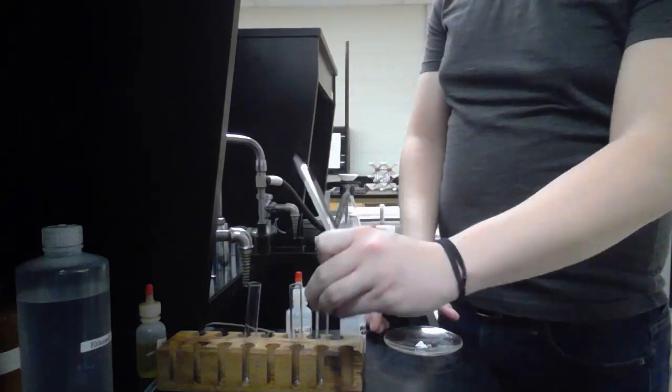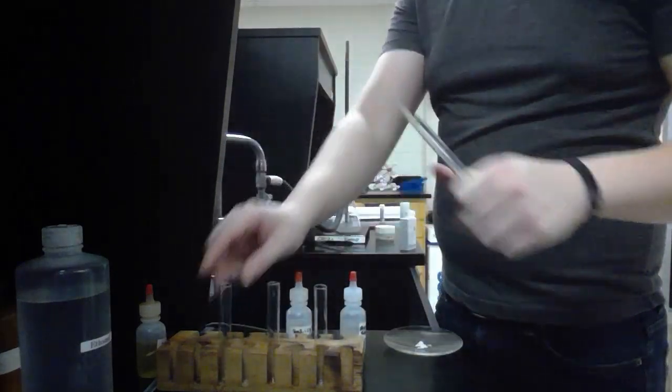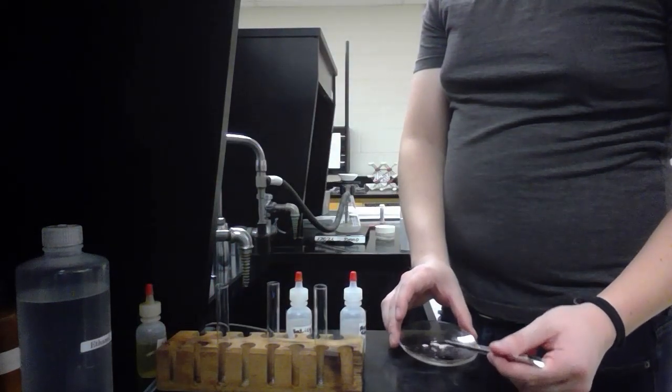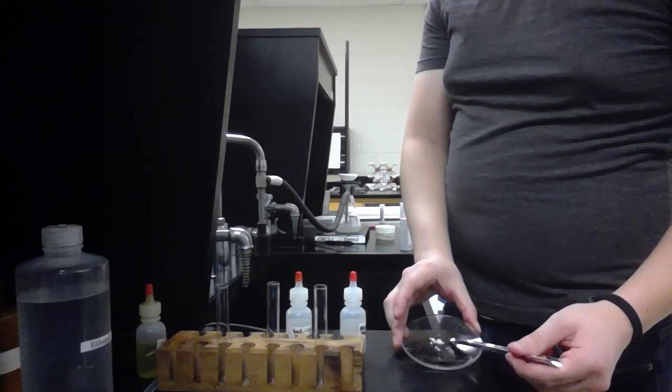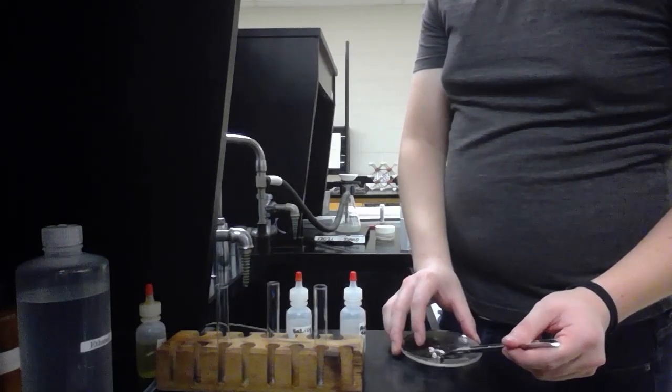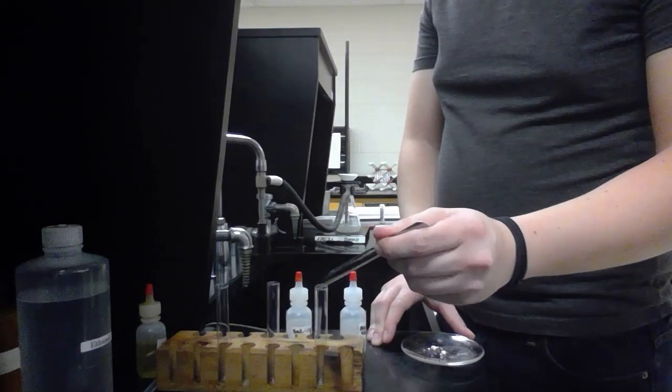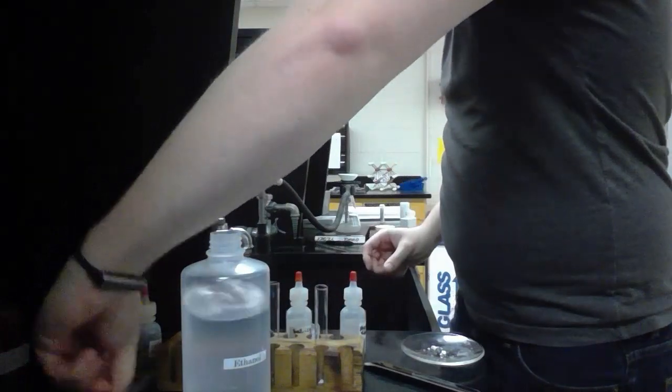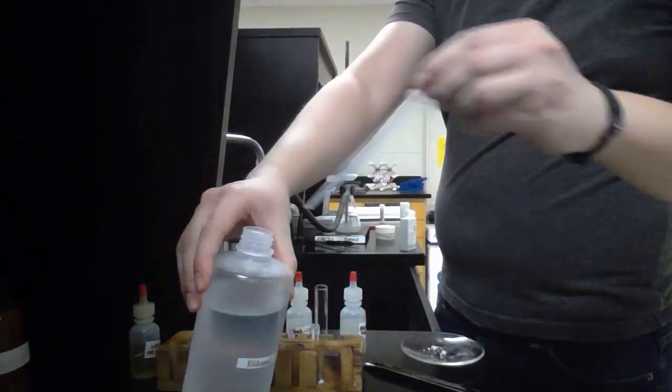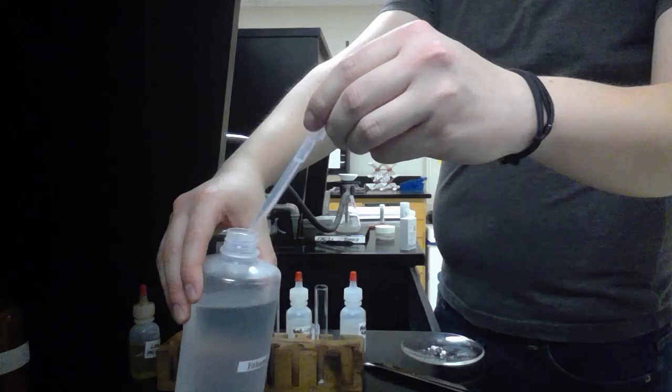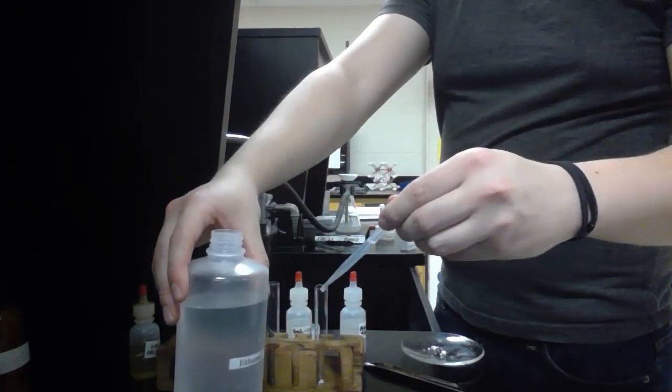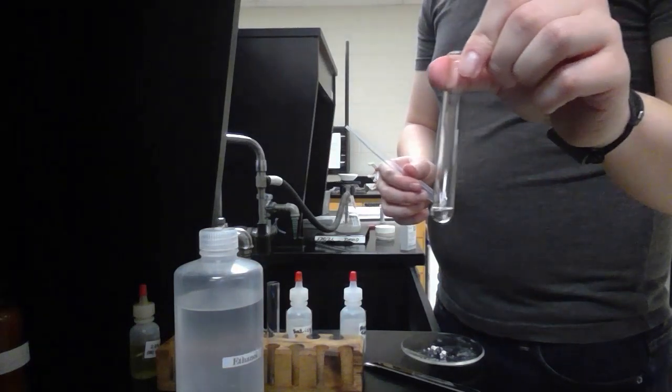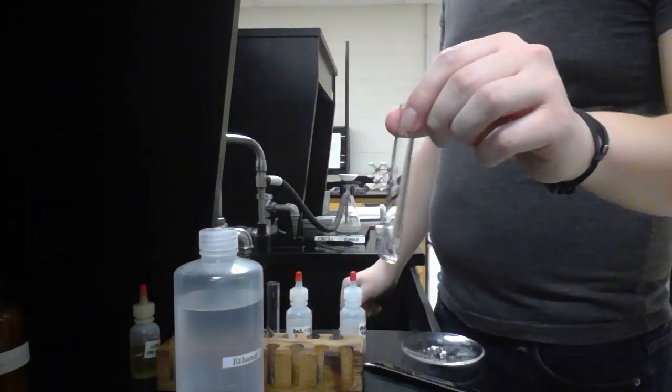Now we're going to dissolve the made product in ethanol, and this is for the preparation of TLC aspirin. We've dissolved the made aspirin in the ethanol.